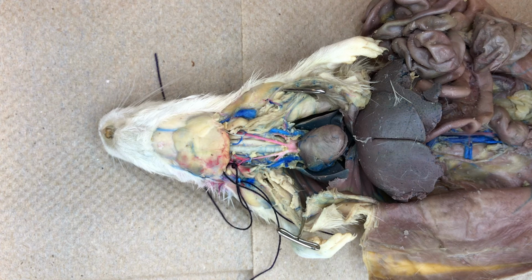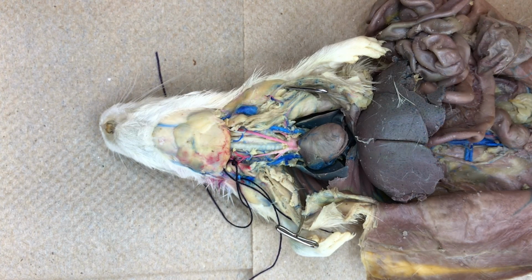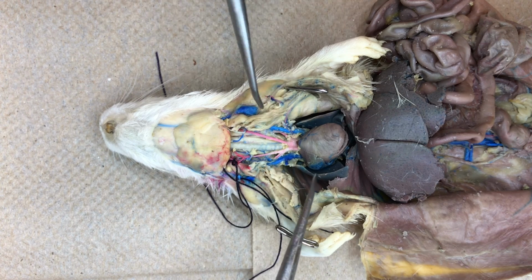The anterior portion of the animal is drained by its own venous system as well. Back in the neck region, we can see that the jugular and subclavian veins drain the head and forelimbs, respectively. This deoxygenated blood then returns to the right atrium and the pathway continues.